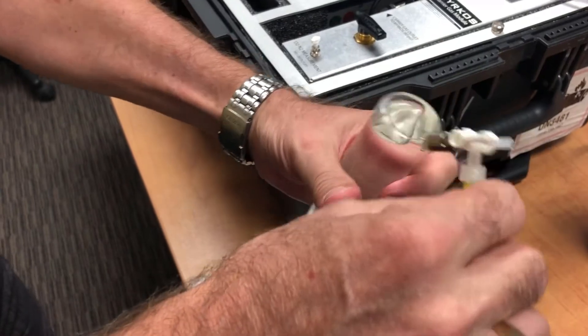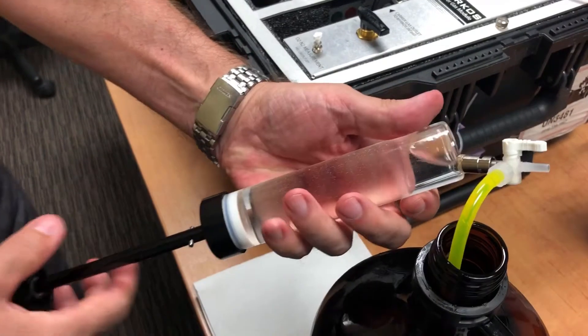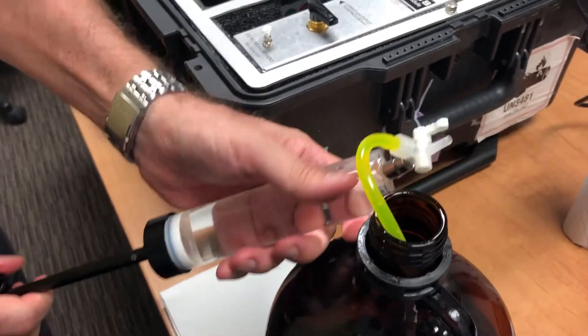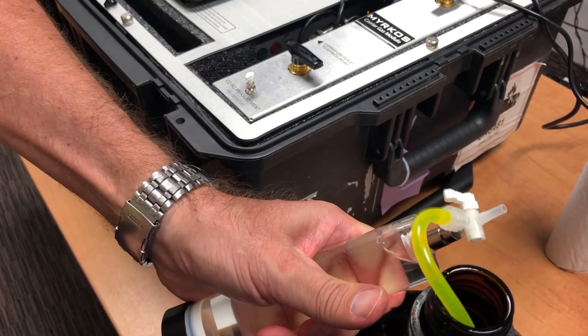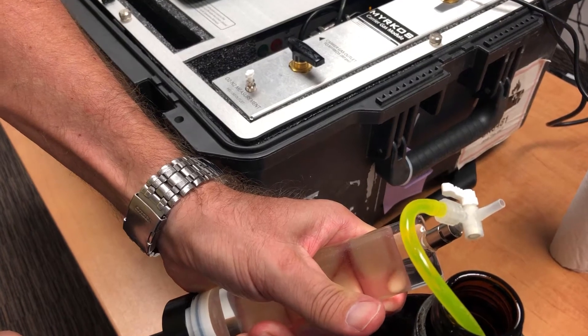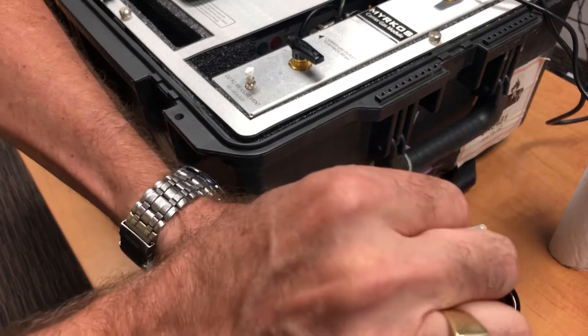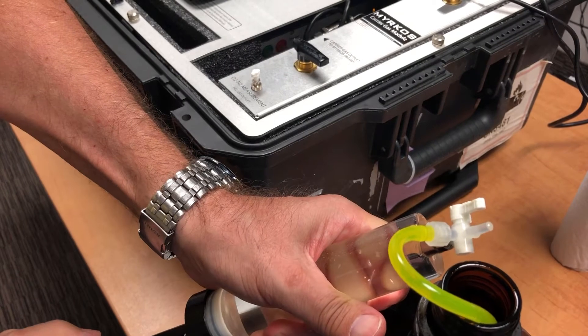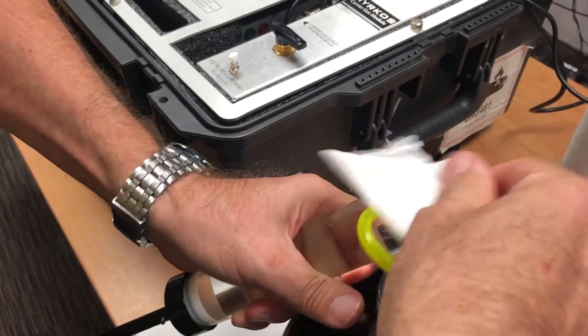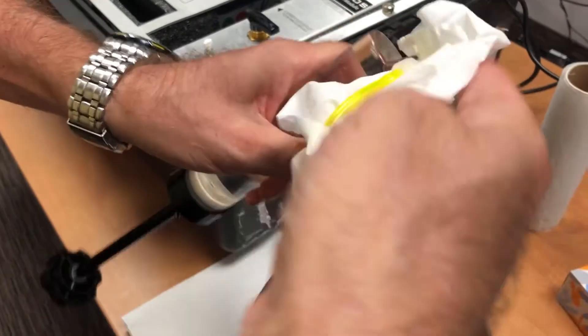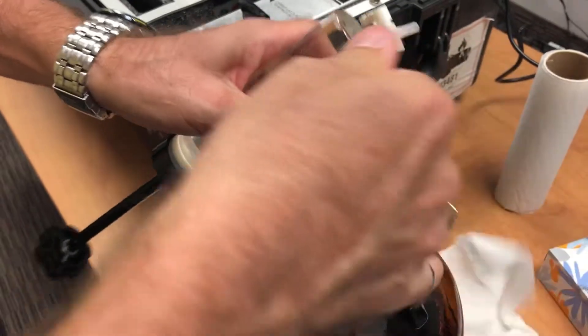Even if there is air here, you can try to push it out. So we're going to push out the air, and fill a little bit of oil, and close it. Try to remove the oil, it's becoming messy.